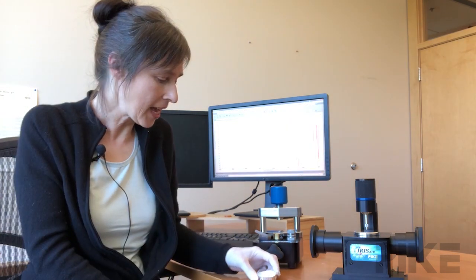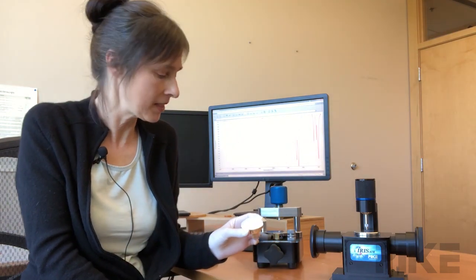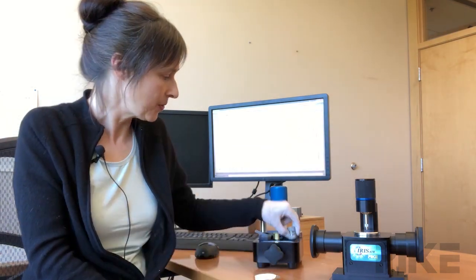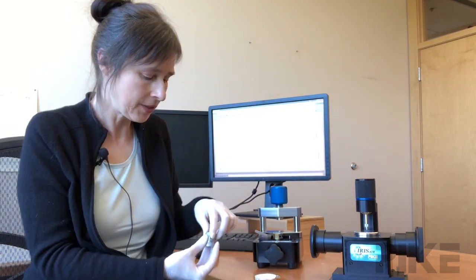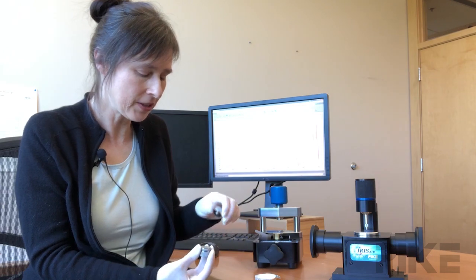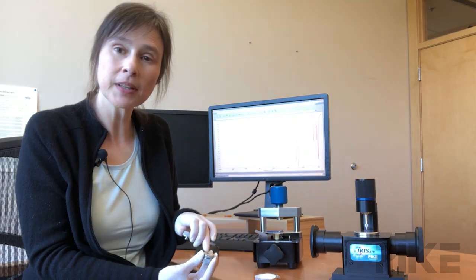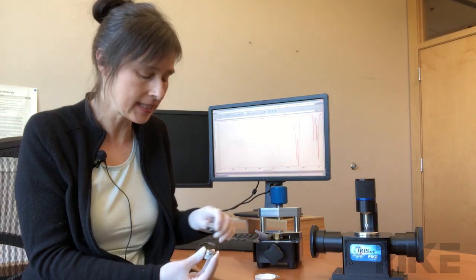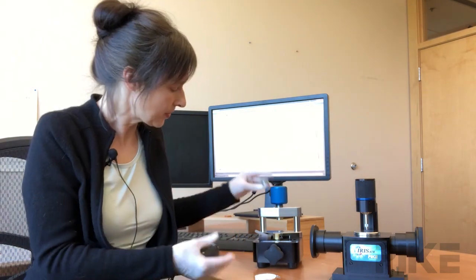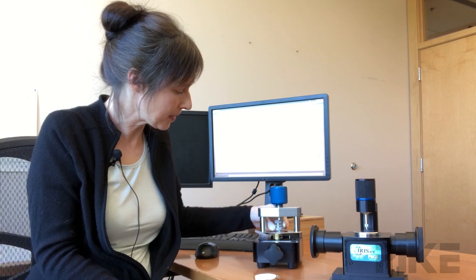So in the lab I found some Teflon resin, it's a powder. Using our Pixie press, I took the seven millimeter die, put a little bit of the Teflon resin inside, inserted it into the Pixie, and applied 2.5 tons of force for just about a minute.